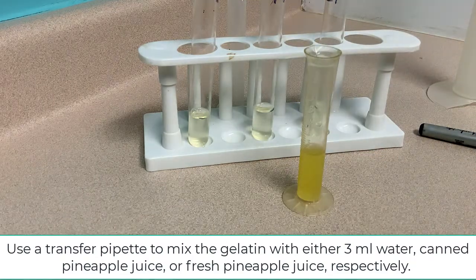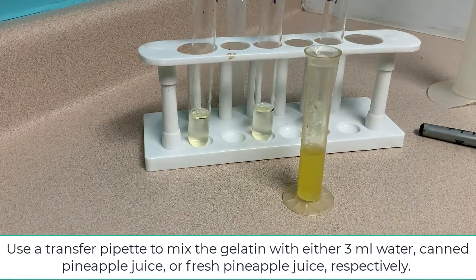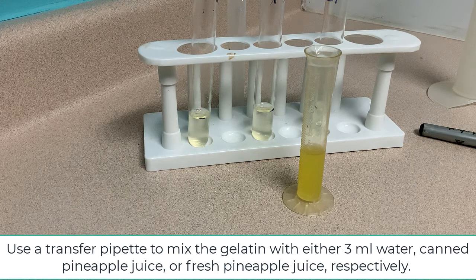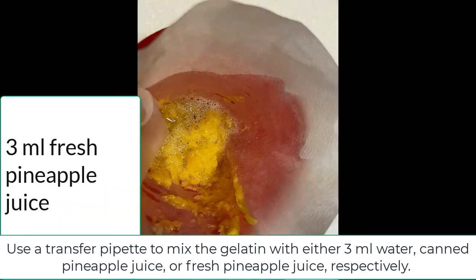Use a transfer pipette to mix the gelatin with either 3 ml water, canned pineapple juice or freshly obtained pineapple juice.